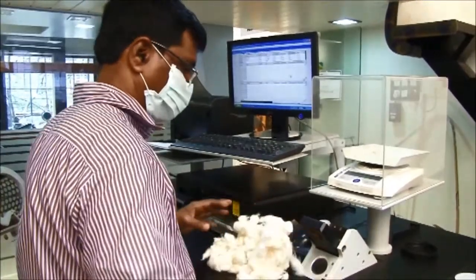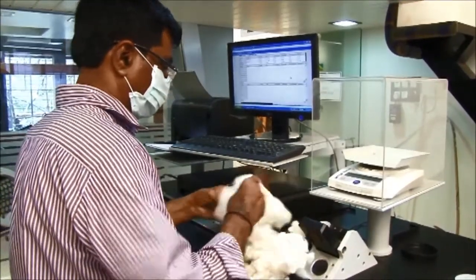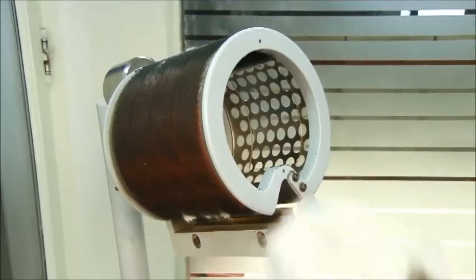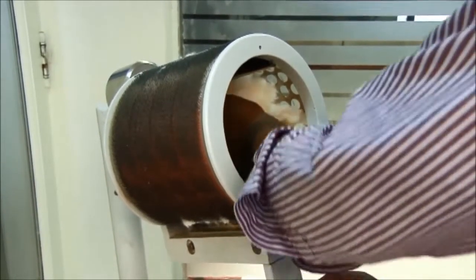For the color module, a smooth representative surface of a cotton sample is placed in the color measurement area and pressed flat with minimum force.